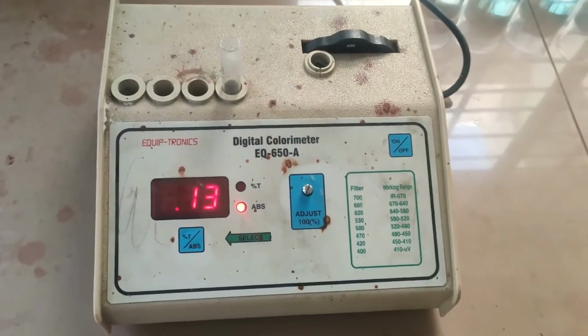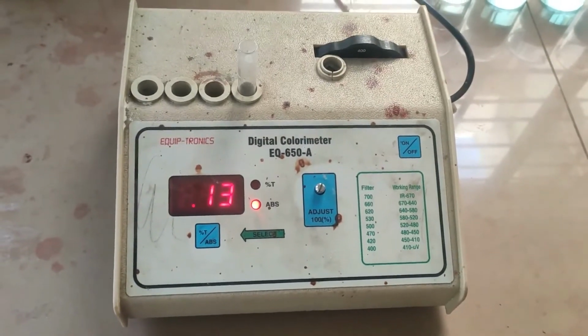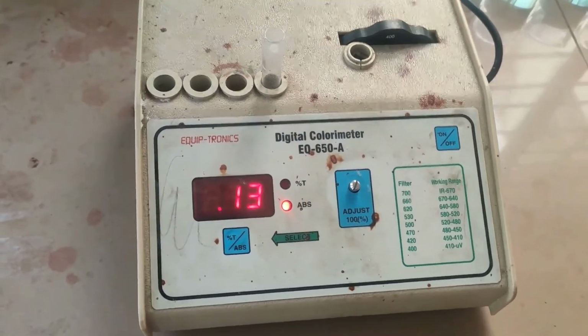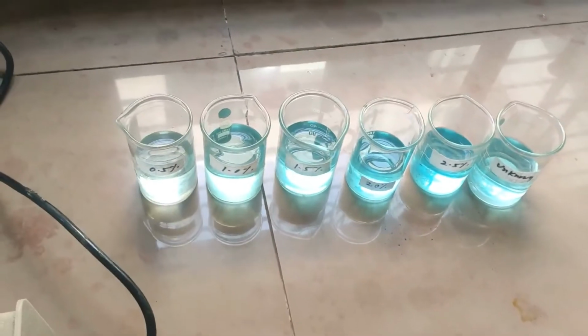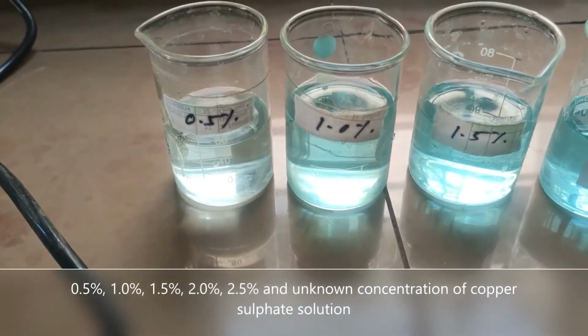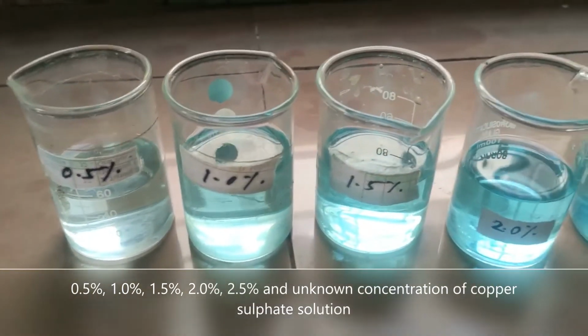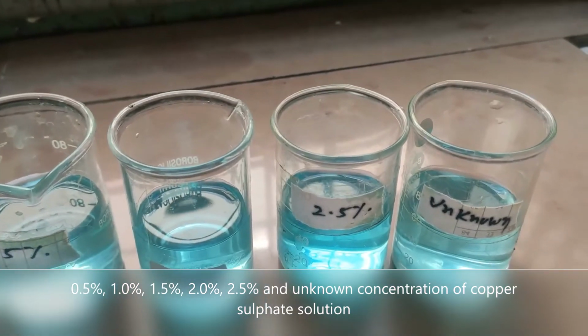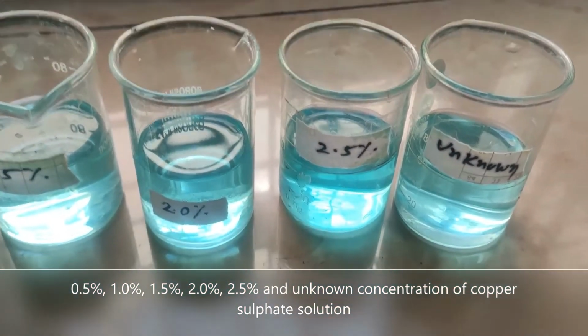Now here we are going to begin with the experimental part, where you can see this is our colorimeter, and these are the different solutions which are having various concentrations. So you can see we have a solution of 0.5, 1, 1.5, 2.0, 2.5 and unknown concentration solution.